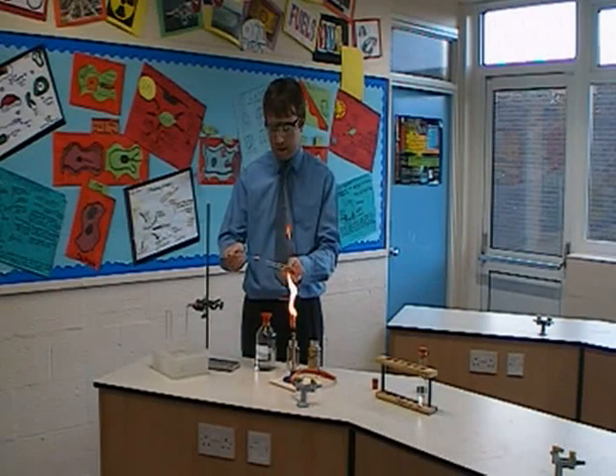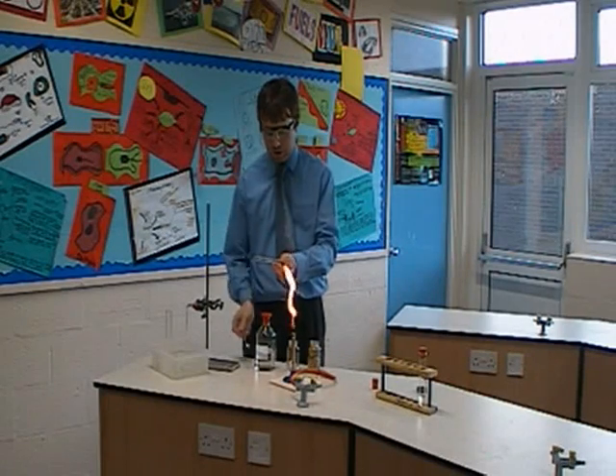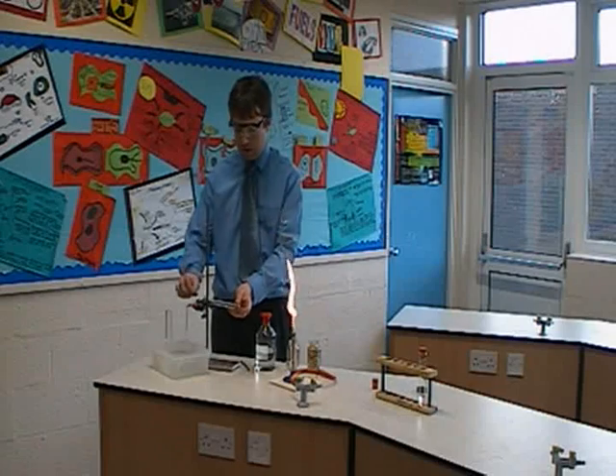The position that we need to add it is quite important, so we add it about halfway down in the test tube, making sure that you hold the test tube on its side and then clamp it into the clamp stand.